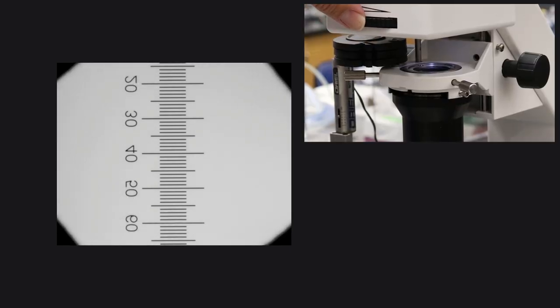After focusing the condenser in this manner, I center it by moving it laterally with the two thumb screws at the top. The field stop should not obscure the image of my specimen, so I reopen it as needed.